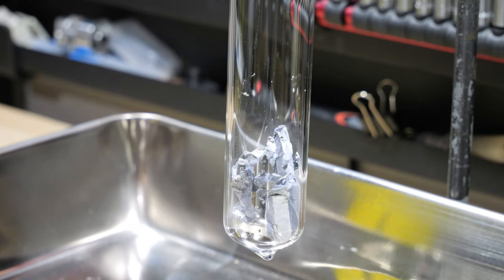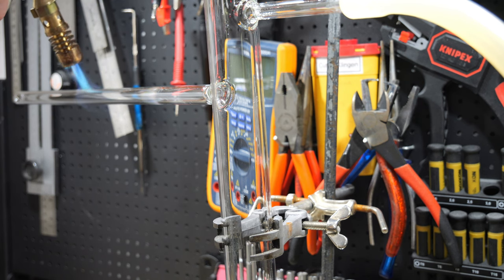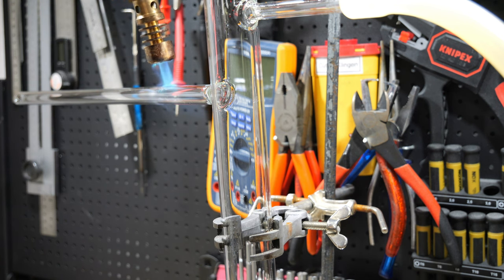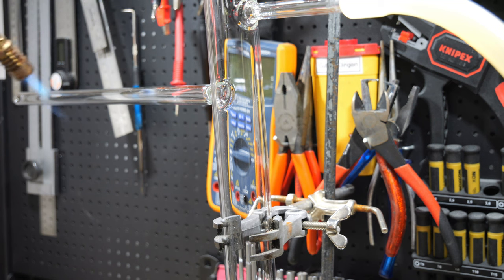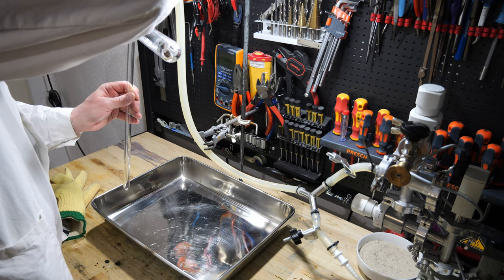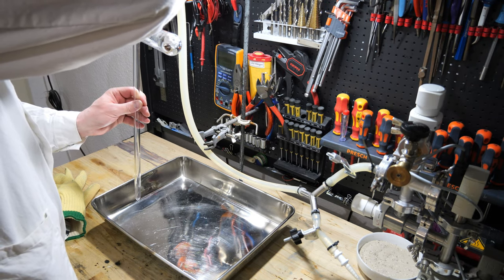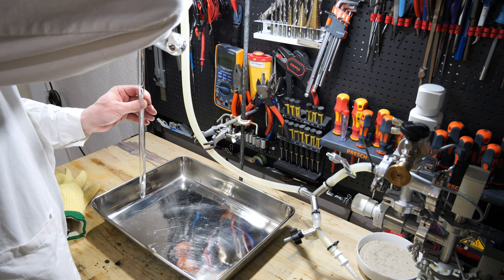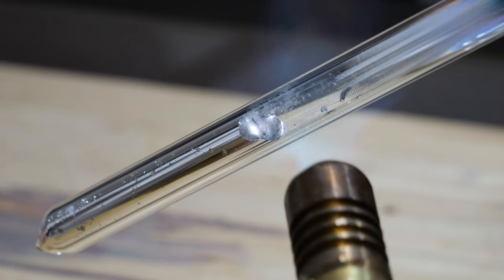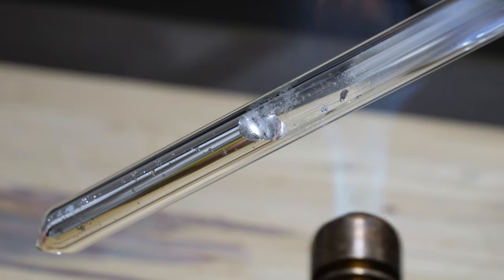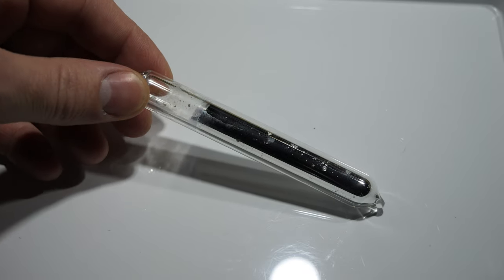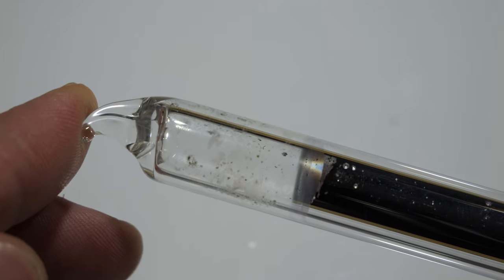When the potassium had melted, I noticed that condensation drops of a liquid were visible on the walls. This must have been mineral oil, possibly left over in a sealed pocket in the potassium and therefore not removed by the petroleum ether. So I spent the next hour chasing the condensation drops through the apparatus until they were gone completely. The conditions for a nice ampoule were already not optimal, but I decided to continue. I heated the apparatus to about 60 degrees Celsius to prevent the potassium from solidifying immediately when it came into contact with the cold walls. And then I put the potassium into the ampoule. During pouring, I could already see that it did not work properly. Nevertheless, the potassium inside the glass tube was melted off as an ampoule. The result was a vial of potassium that was not terrible, but not satisfactory either. You can definitely see oxidation products on the walls of the ampoule.